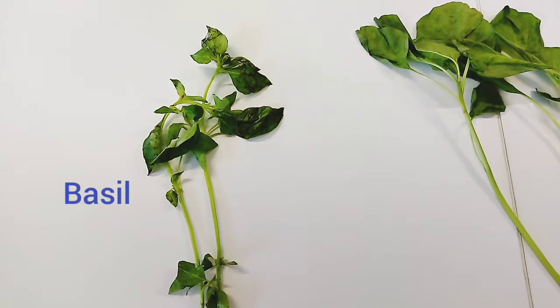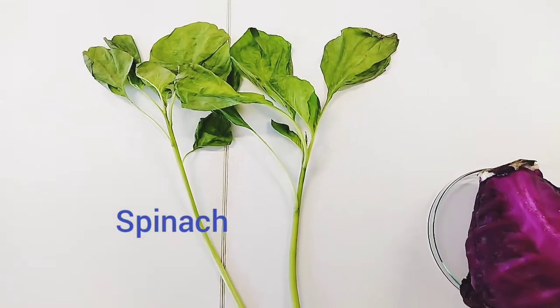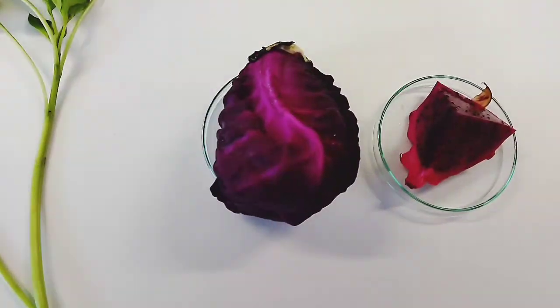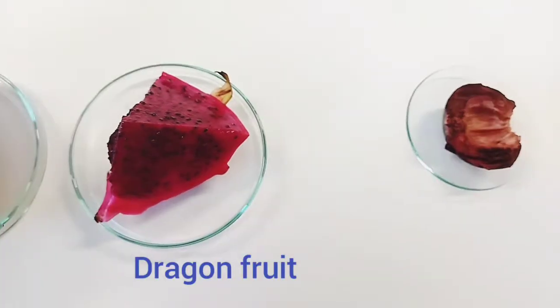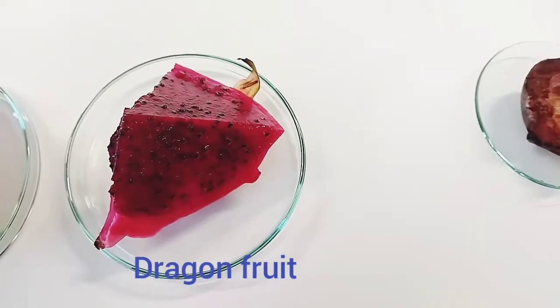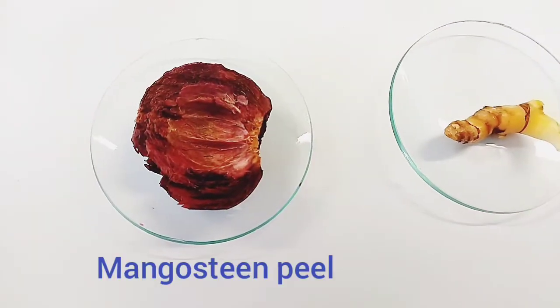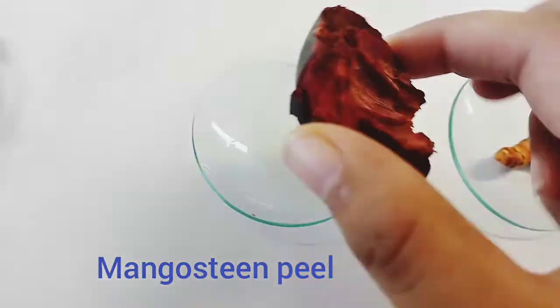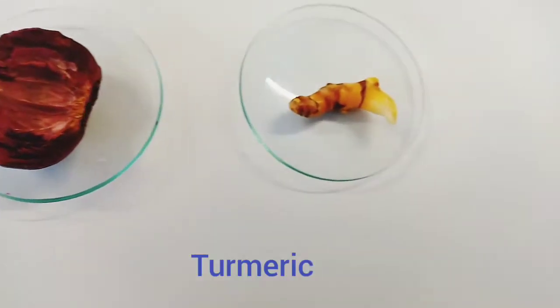We are using natural samples. They are basil, spinach, cabbage, purple cabbage, dragon fruit, mangosteen peel, and turmeric.